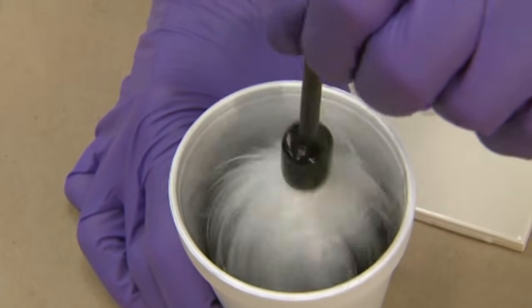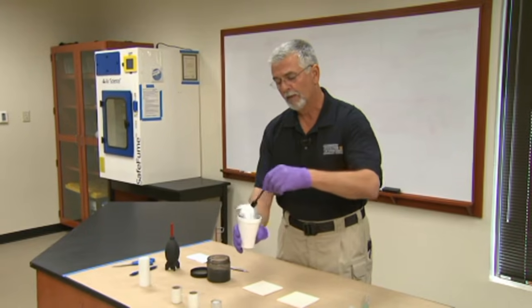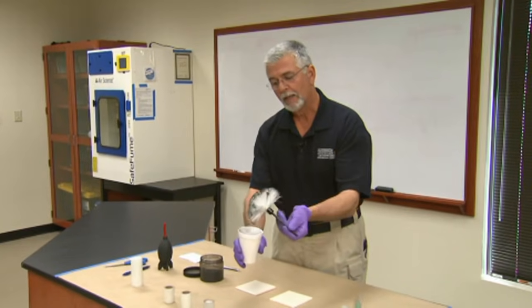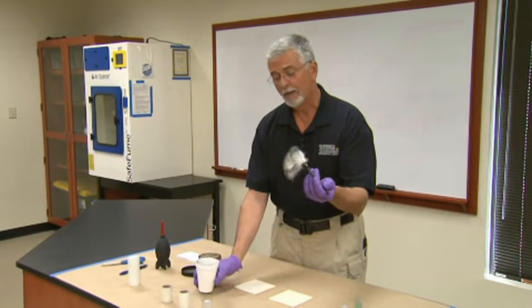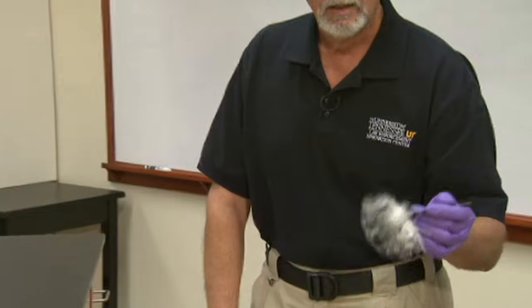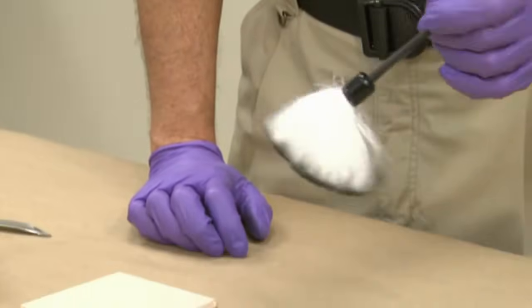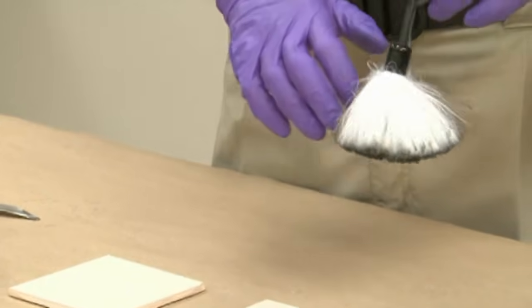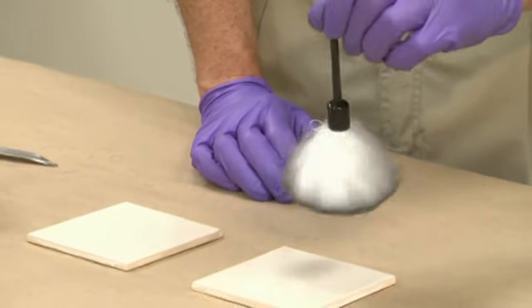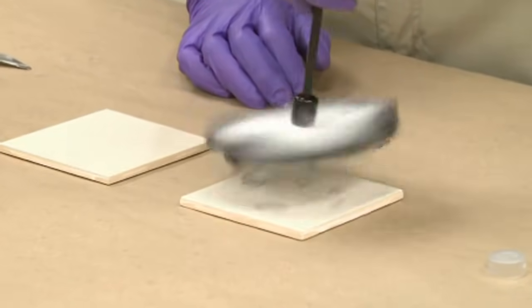Put a small amount of powder into the cup, take the brush and put it in lightly, then tap it. Raise it up off the bottom and spin it, then tap the edges of the brush. Now I've got more than enough powder on this new brush to process quite a large area. Techniques vary — some people like to spin the brush, some like to move it back and forth. I'm just going to spin it and go across this surface.